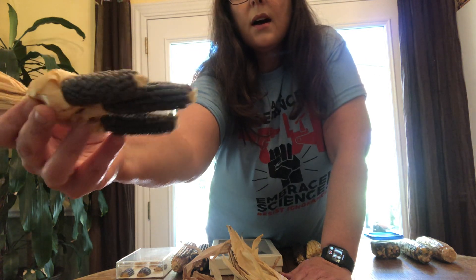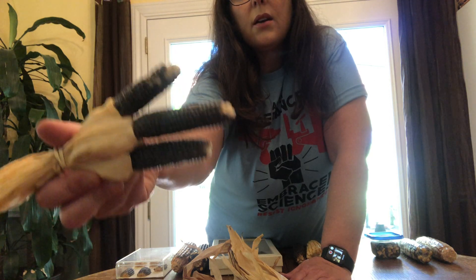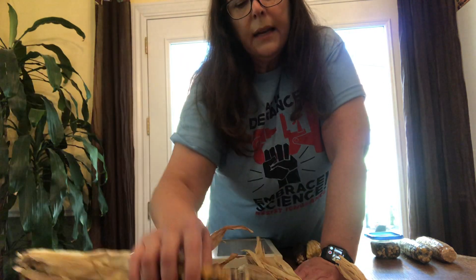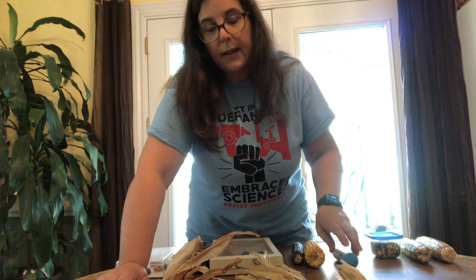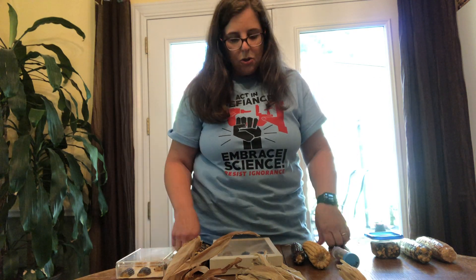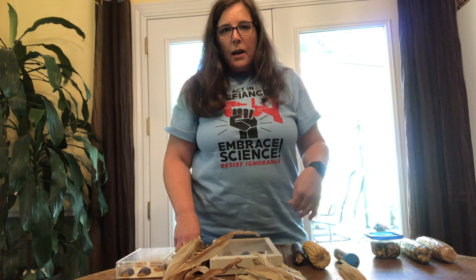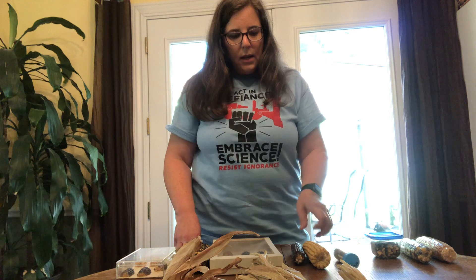Some phenotypes result in really small cobs. This is a blue type of popcorn that I grew in my backyard a while back. I grew some more corn this year with more of these phenotypes, but I planted it a little too late and it hasn't made corn yet — hopefully I'll be able to show you before the end of the semester. Now, this experiment deals with specific phenotypes of corn, and we're going to follow those phenotypes through both monohybrid and dihybrid crosses.